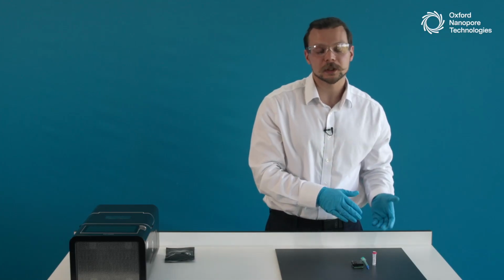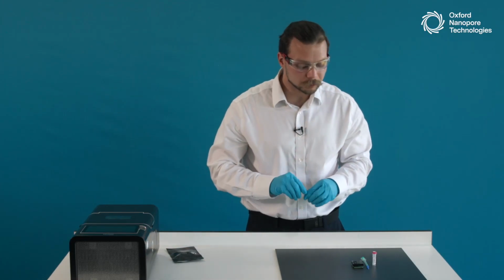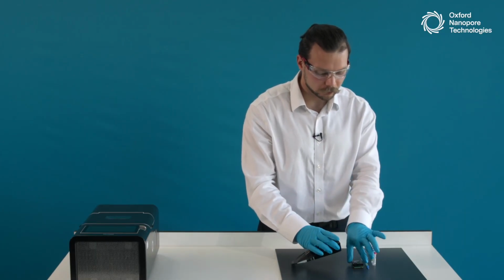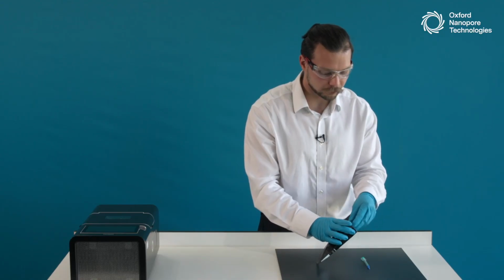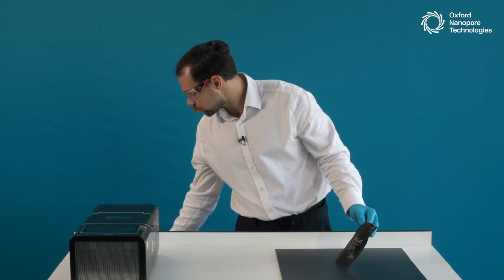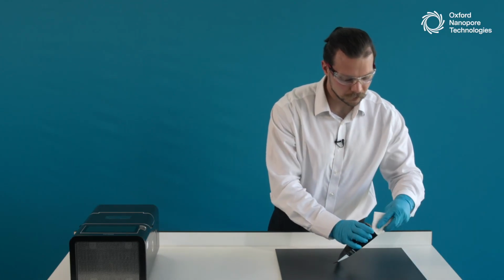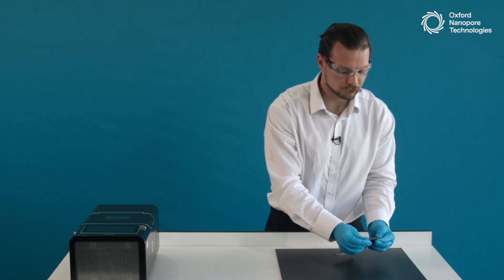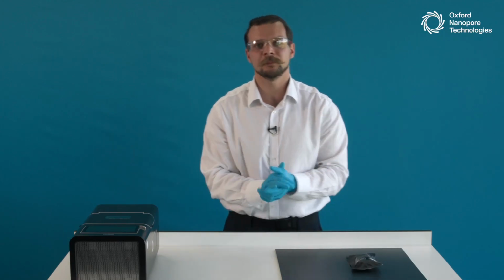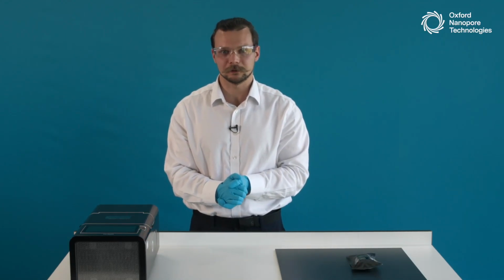Now, if this was a real flow cell, we would be able to put it onto the device, but because this is a demo flow cell, it cannot be put onto the device, so I will just take the pouch that everything came in with, and I will dispose of the flow cell, the reagent tubes, and the syringe, as well as the tissue, if you have it, back into the pouch. So I'll just pop it in here and seal the pouch to make sure I can dispose of it in accordance with local regulations. Thank you very much. Congratulations on loading your first PromethION flow cell.